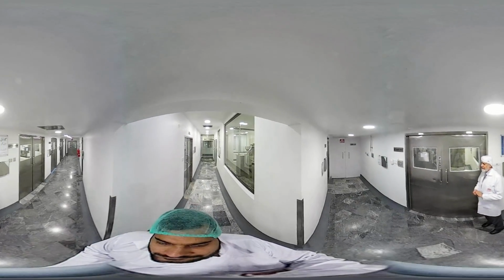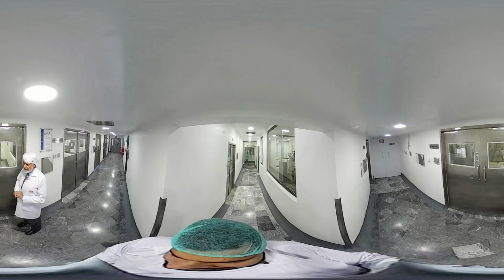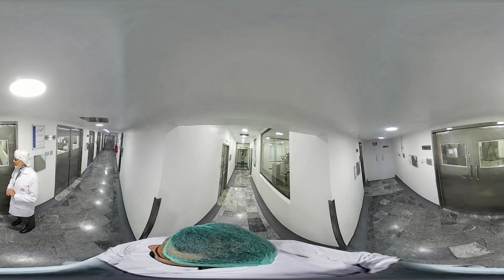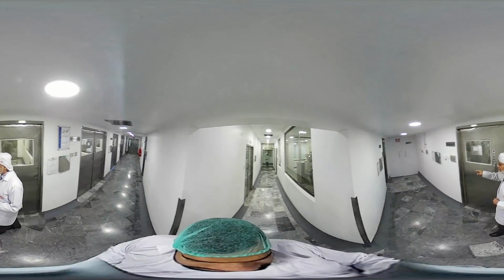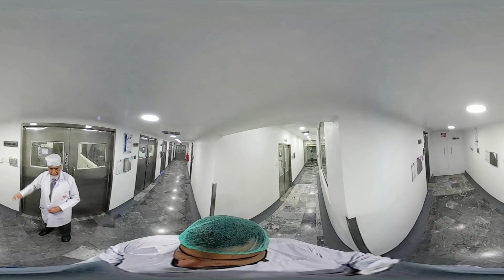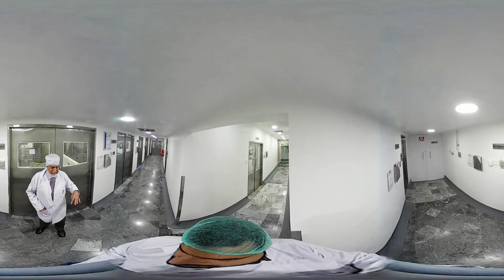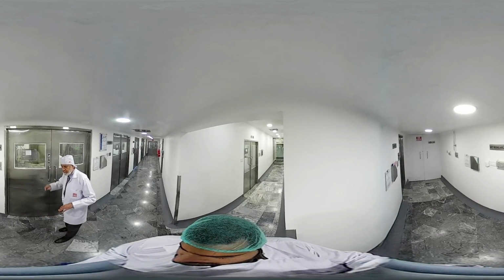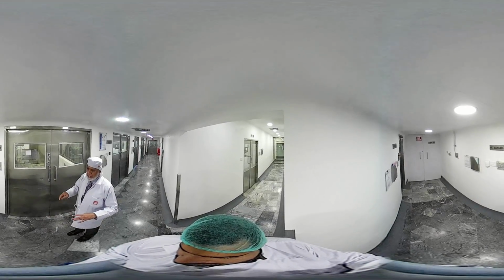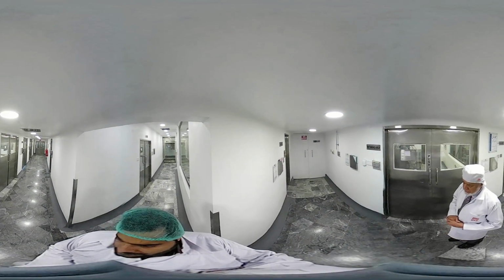You can see it's a high shear mixer with a capacity of almost 150 kilograms. Wetting is done here, and you can also see all those differential manometers installed in every workshop to make sure that the production workshop itself is at negative pressure, and the corridors external to that workshop are at positive pressure.